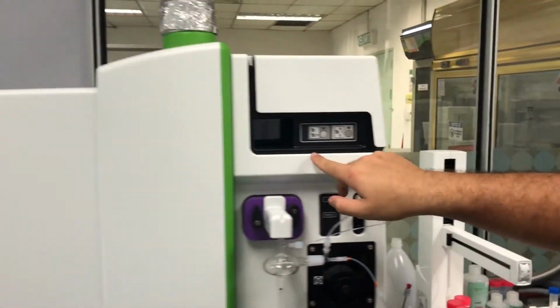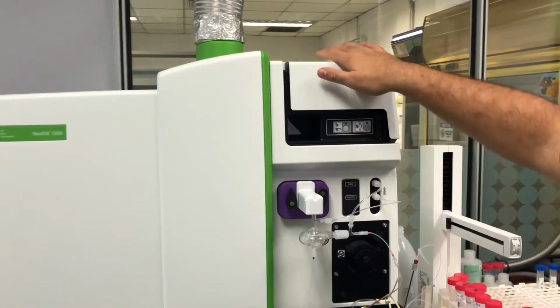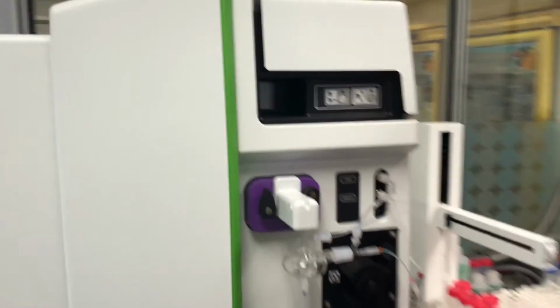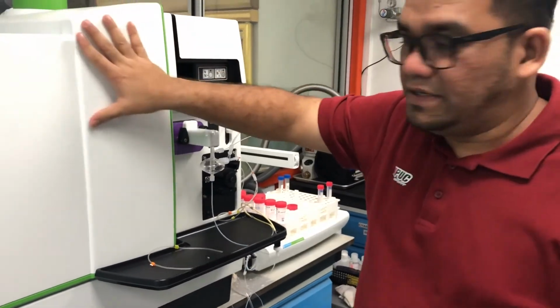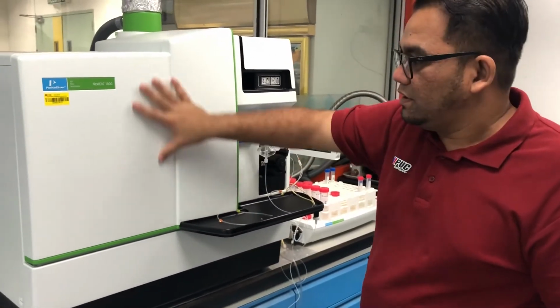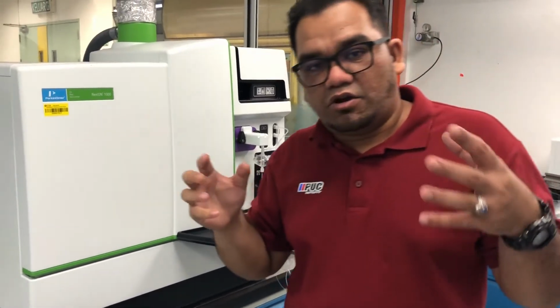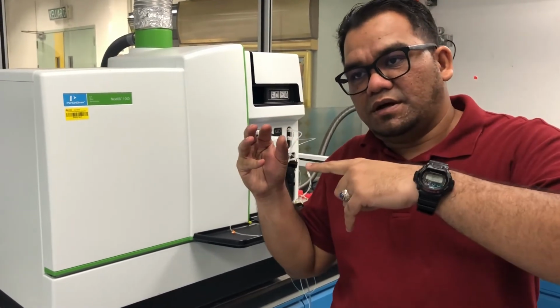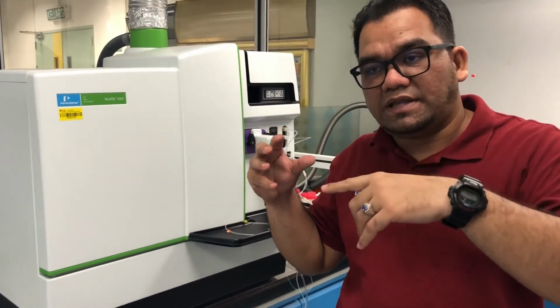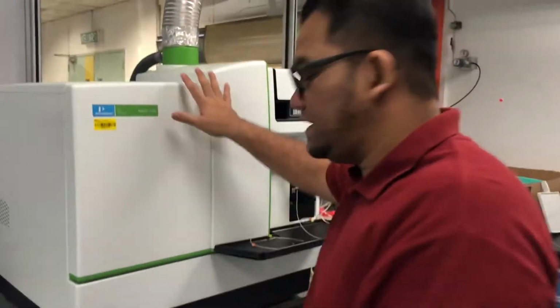Here we can see the plasma signal, the plasma inside there. The concept is similar: the sample will be pumped inside the plasma, and then we have the MS detector here, mass spectrometry, a mass spectrophotometer inside here, and we have a quadrupole inside there. The quadrupole's function is to let only one atom pass through at a time, and the instrument will analyze what the atom is based on its mass, right? So this is ICP-MS. Now we can see the ICP-OES there.